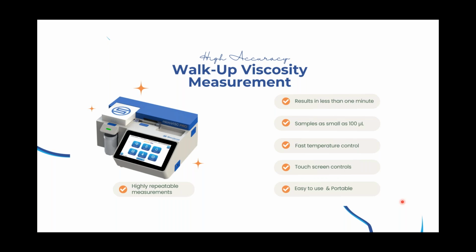So another thing my colleague mentioned was the temperature control, the Peltier control. So because of this, there's no longer any need to put this unit in a box or to connect it to a thermocube. Another nice thing is that the data can be exported quickly to Excel just using a USB drive. You connect to the side, go to the data, tap to export, and that's it. So there's many other new features, and we'll save those for the next webinar where we'll cover more of these features.